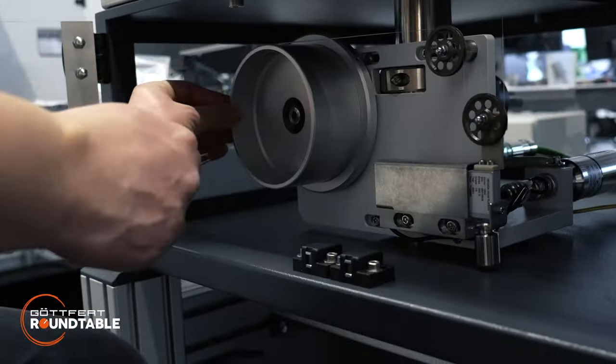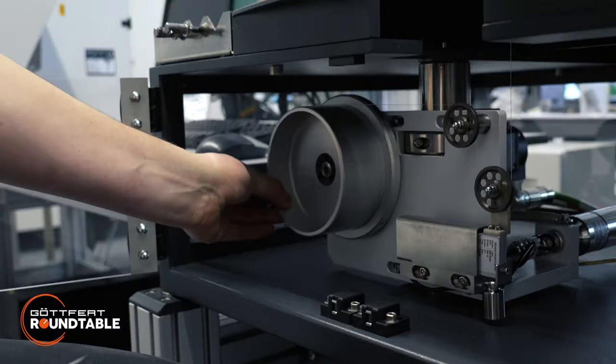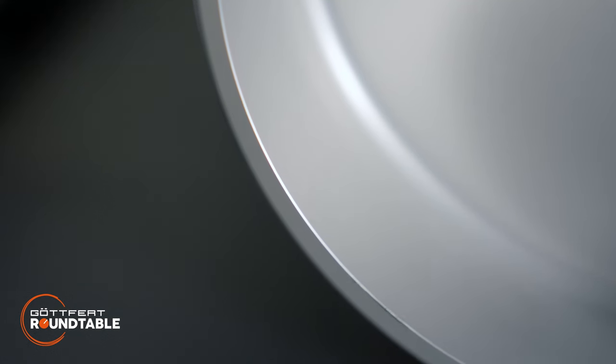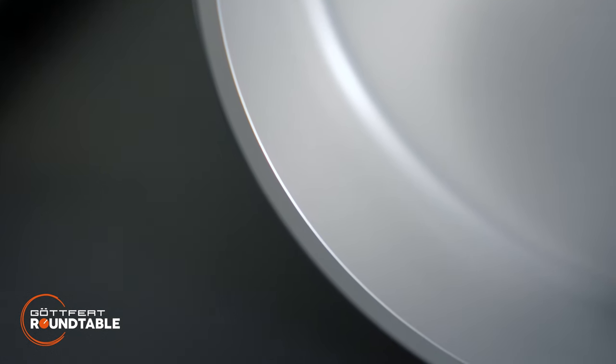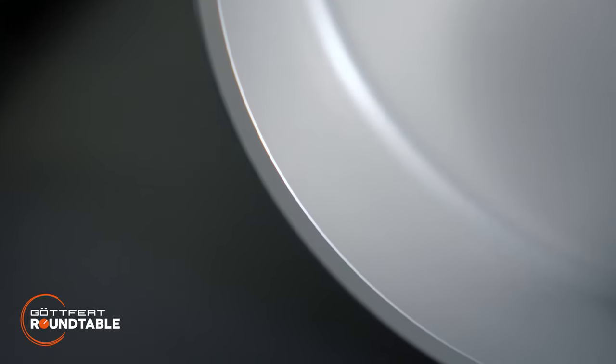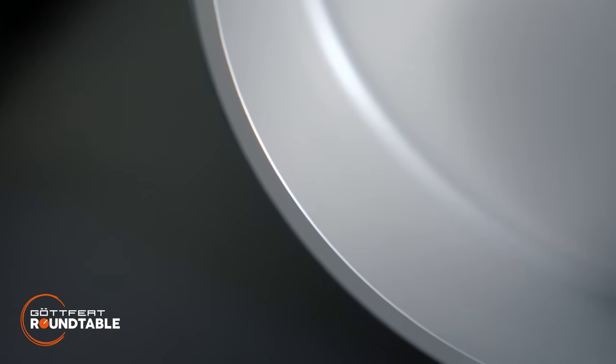The velocity profile run on the big winding drum is automatically calculated based on the target MFR of the material, and it's part of the product and parameter set. After winding, as I said, the operator can leave the machine and the test runs fully automatically.